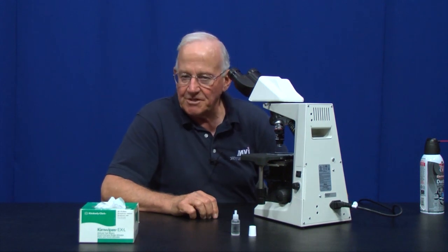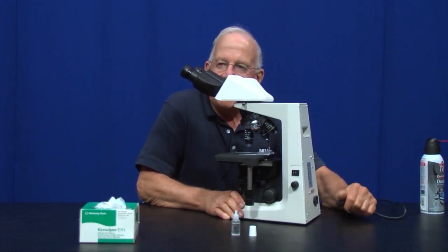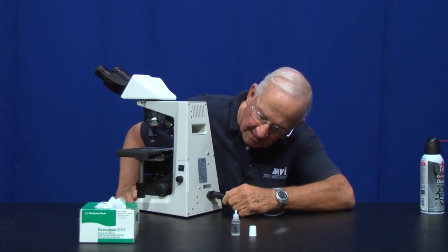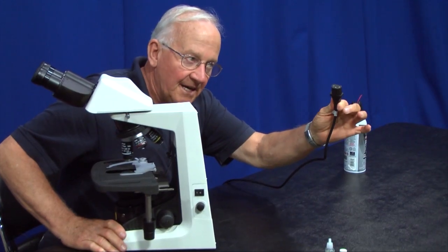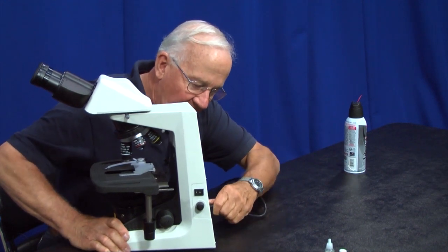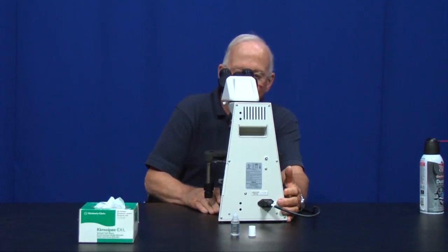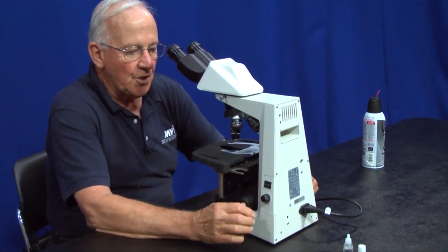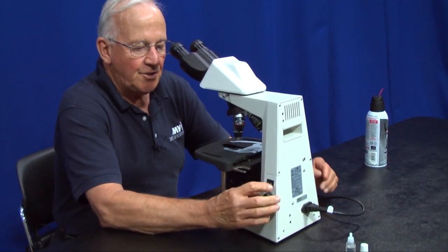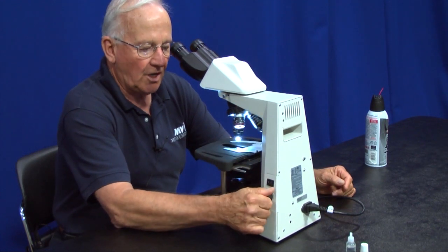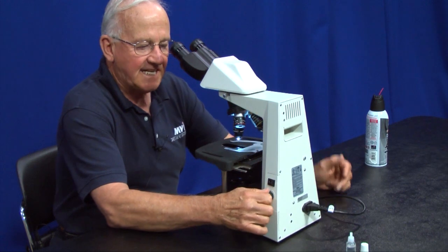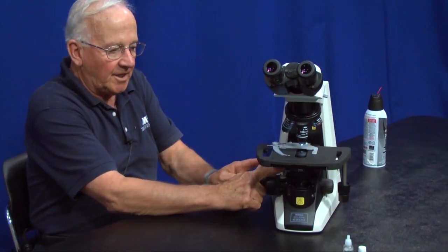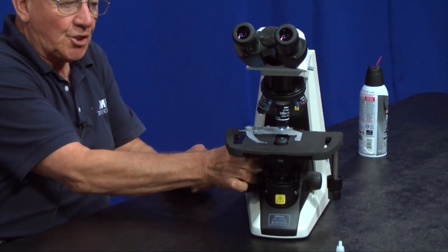Now that we've talked about all of the parts of the microscope, we're going to talk about using the microscope. When you first get the microscope, maybe you'll be asked to get it out of the cabinet. It'll come with a cord. You're going to have to plug the microscope in with a standard computer type three-prong cord that plugs into the back. Turn it around so it's comfortable for you. On the right-hand side of the microscope is the on-off switch. You don't have to worry about the intensity of the light. You can turn the switch on any time whether it's turned all the way up or down. You can see it getting brighter as I turn it up.